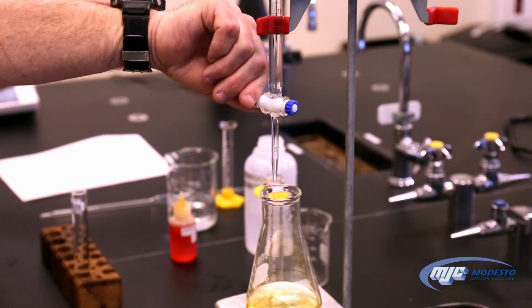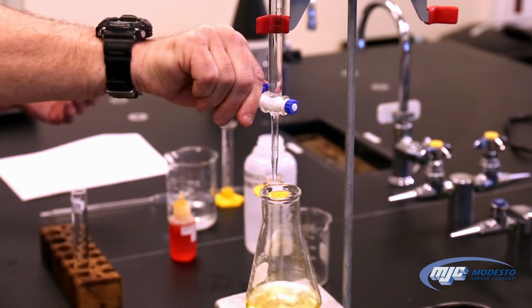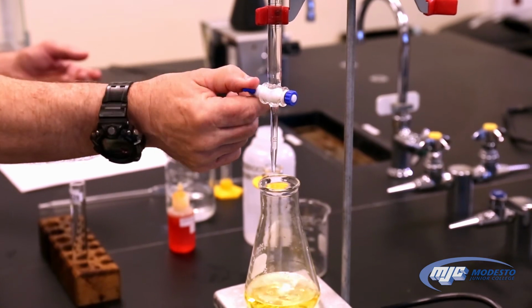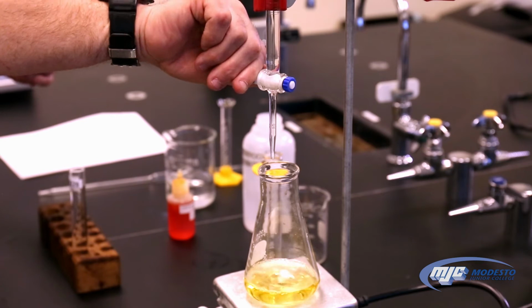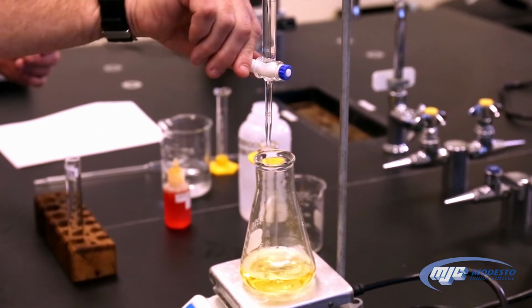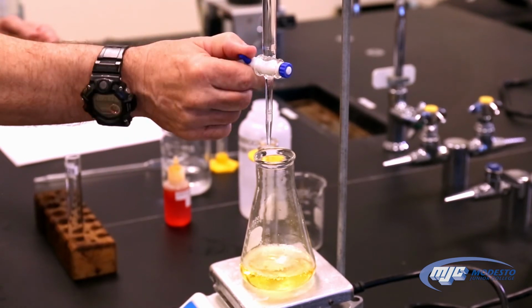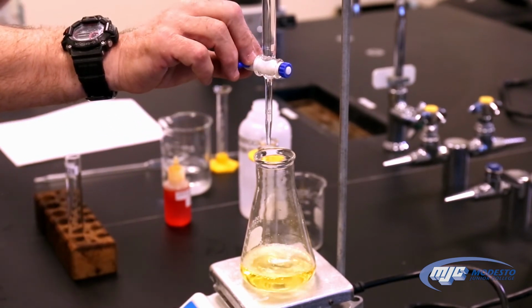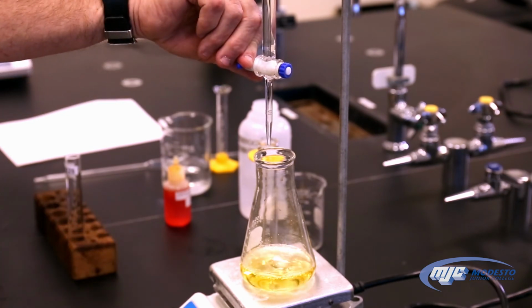So going fast with the buret means twisting the stopcock kind of slowly. So I'm going to go like this. That's a pretty slow twist. And I didn't see any color change really in there, so I can do the same thing. Just like that. Once I start seeing splashes of color that go away, I'm going to slow down, and that means that I'm going to twist the stopcock faster.